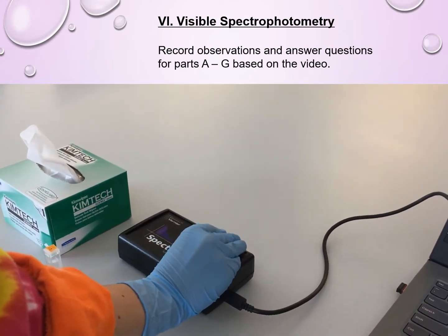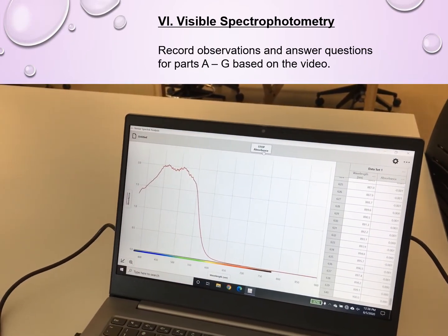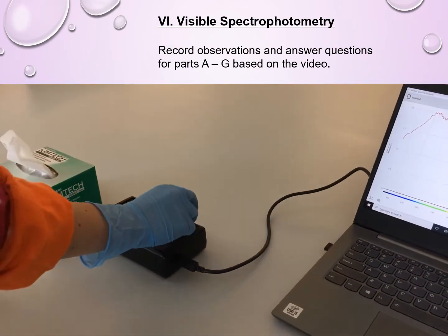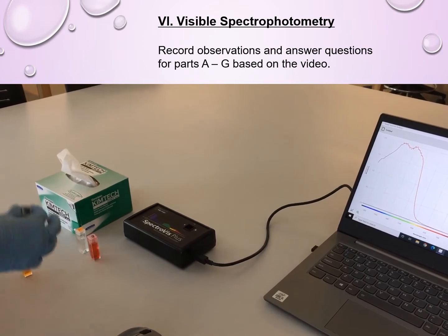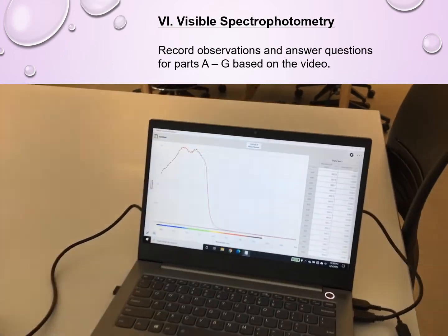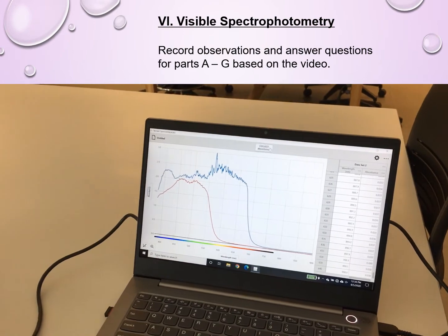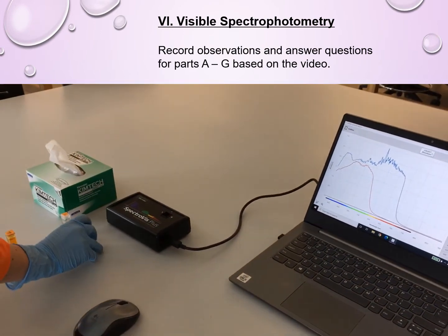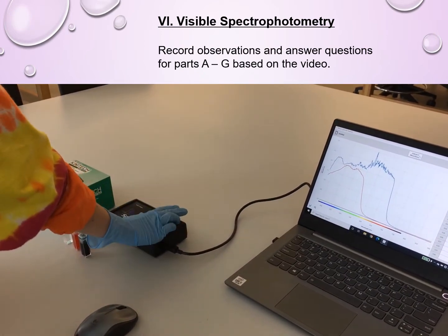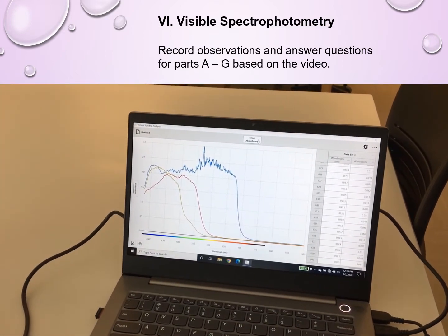So again, she wipes, she places it without ridges in the light path, and then she collects the absorbance, and you can see the full spectrum of the absorbance for this red sample. Pay special attention not only to where the peak of the absorbance is, but also the shape of the graph. So is it one unique peak, or is it kind of a wider spectrum? Because all of that could have an effect on your interpretation of your data when you're answering questions later in the lab. Okay, and then she's reading out the last one, and you can see the absorbance here.